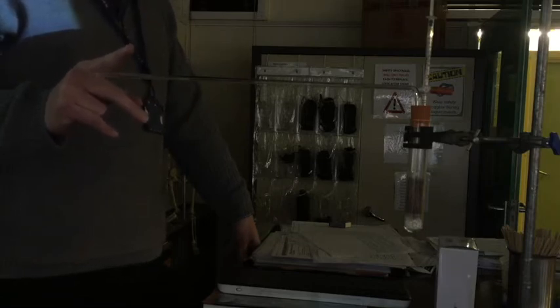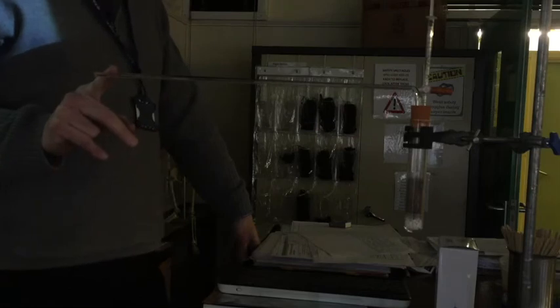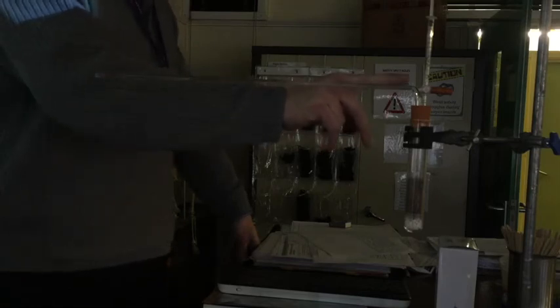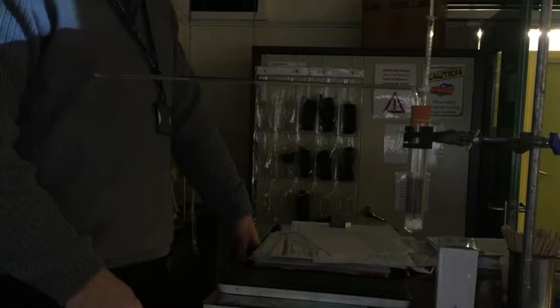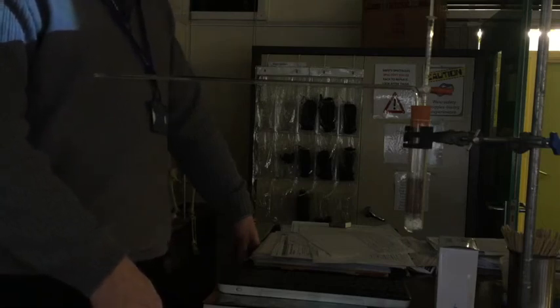And then you're going to stop the process by opening the valve again, and that will stop the thing from moving. So the stopwatch will start when you turn this valve. Now when it ends, you turn the valve back to its position. So that's the trickiest bit in this practical. Once we've measured it at room temperature, we can start introducing our variable. So what's the variable you think that's going to affect the rate of respiration of these maggots? What variables might affect it?